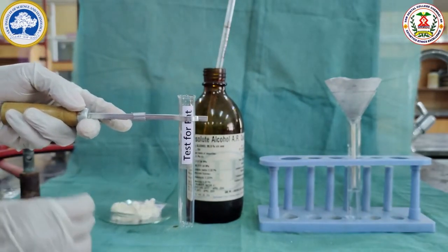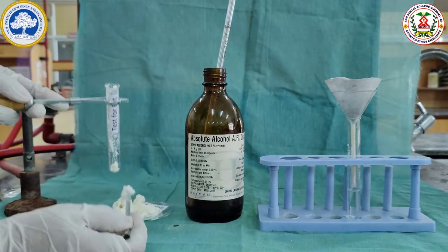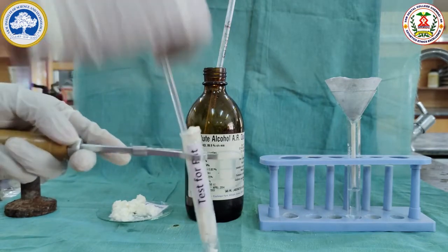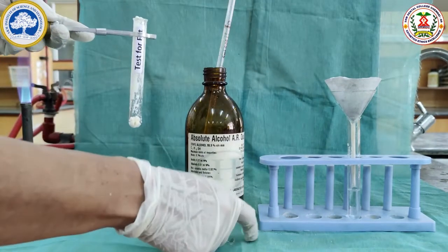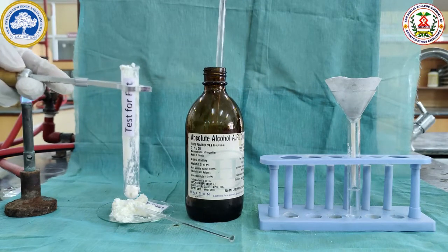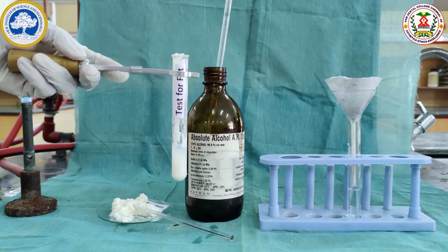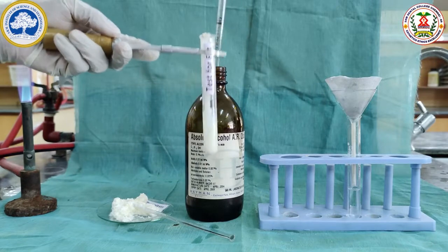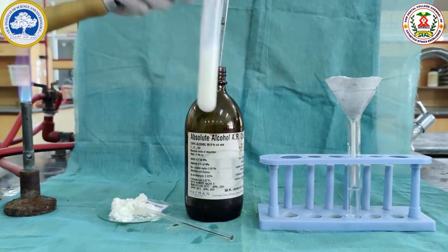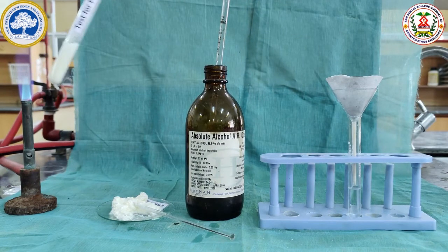From the precipitate obtained from the milk separation, we are going to do the test for fat. For this, we are going to take the precipitate and dissolve the fat. A little of the precipitate is taken, then this is dissolved by adding 5 ml of alcohol to dissolve the fat from the precipitate.